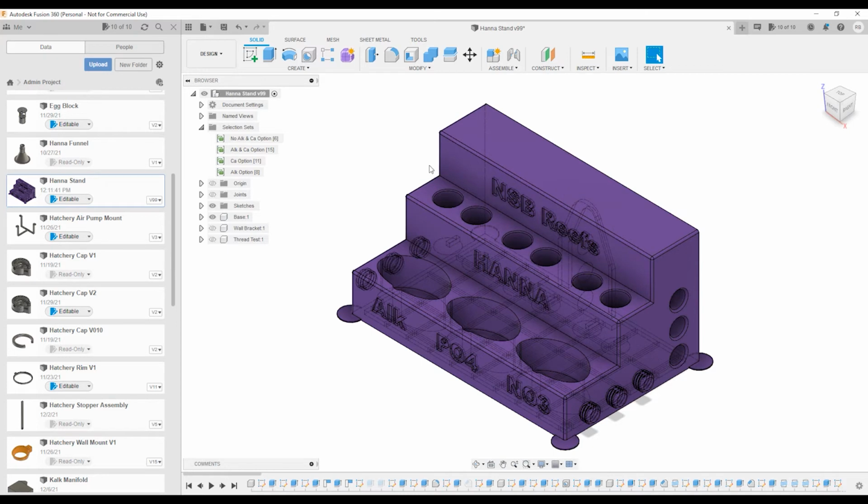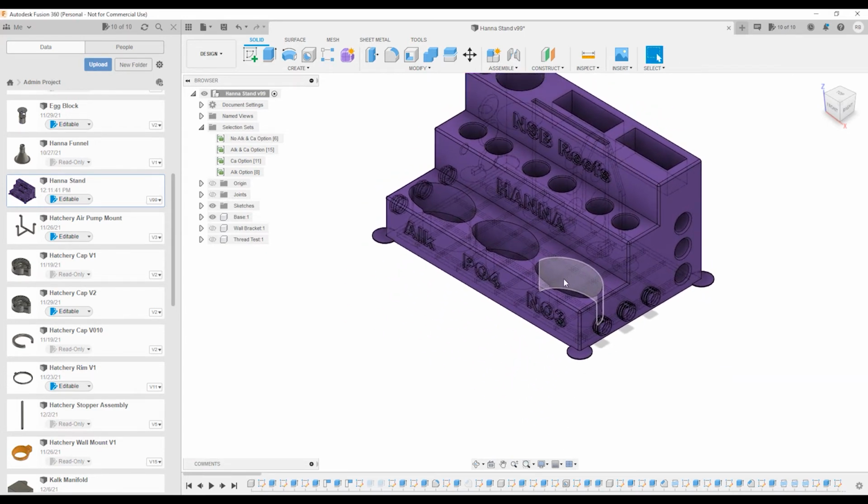give your PC a moment to refresh that in the browser or the window. And then we're going to go ahead and say, hey, instead I want to use the ALK option, which is the alkalinity plus any two other tests that are not calcium. So I'm going to click the select button, and then I'm going to right click and click unsuppress features. And then you can see here we have the space or feature for the liquid alkalinity reagent and then two others. Now let's say we wanted to not use phosphate, but let's say instead I use the copper.